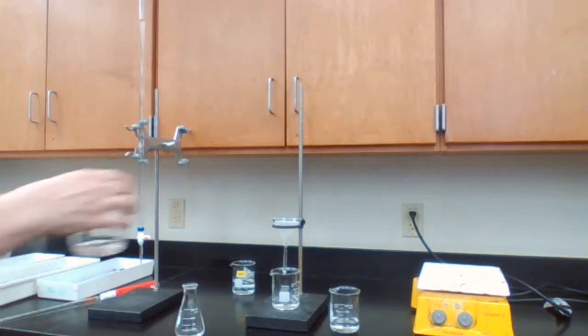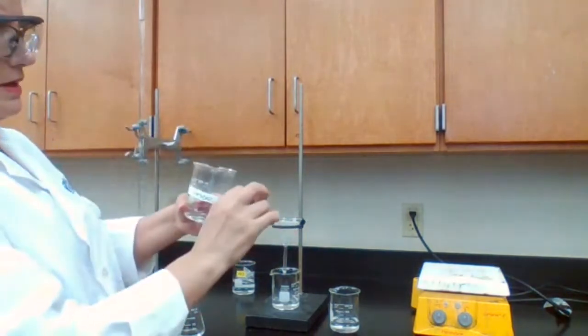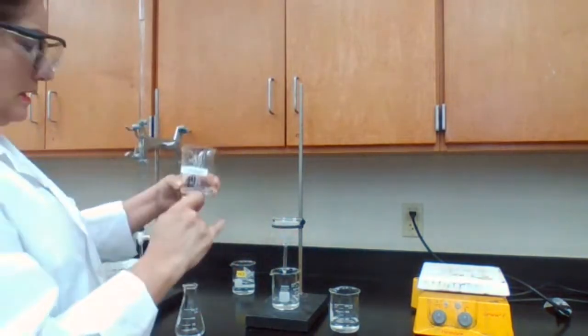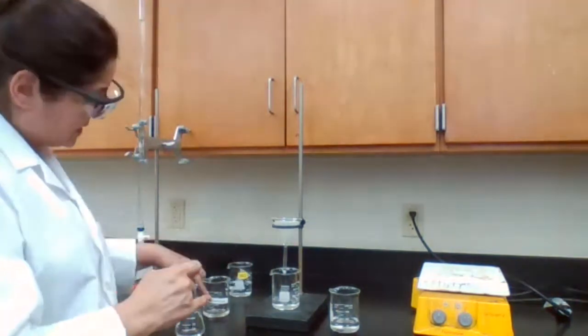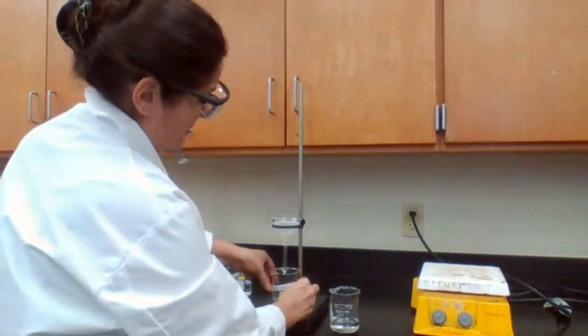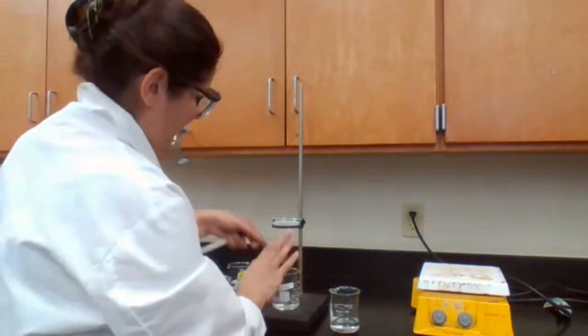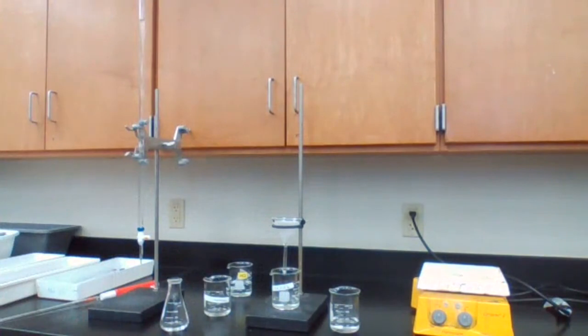When you're doing titration, all the beakers must be labeled, because the solutions have the same color. My HCl is already labeled, there's the waste container, and this is the calcium hydroxide that I'm using. If it doesn't have a label, it's not valid. You shouldn't have it at your station.